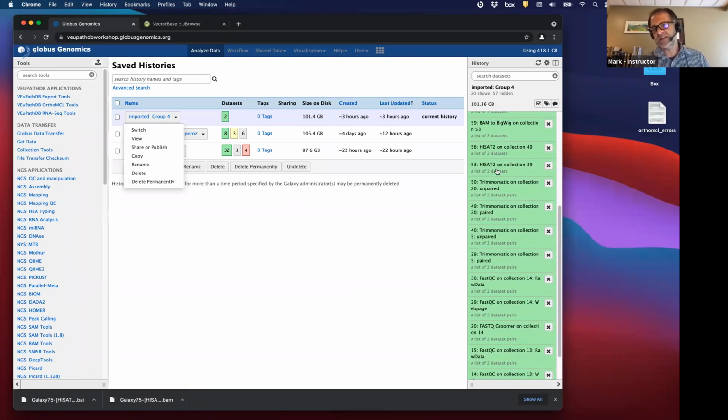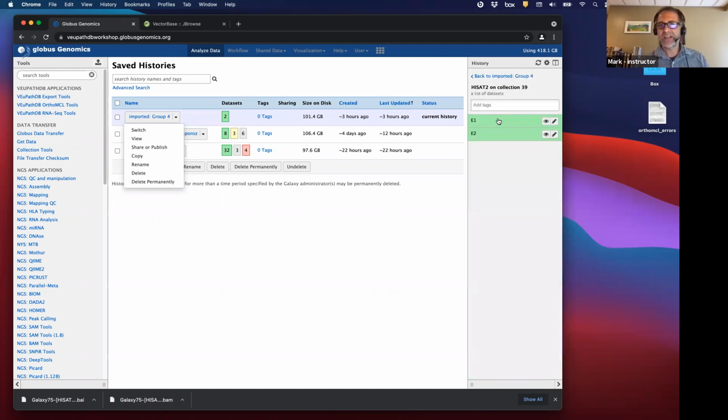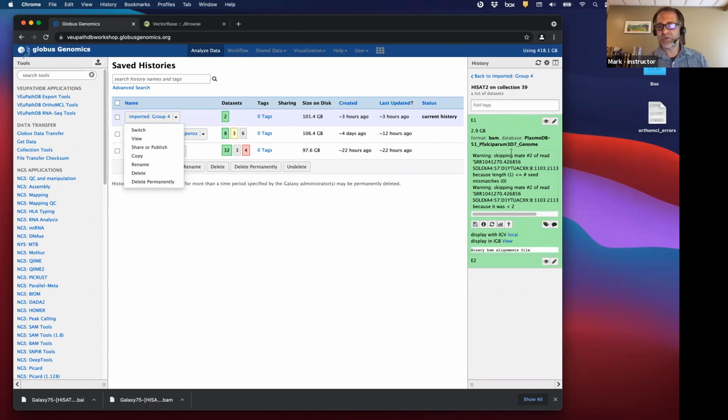And what this does is it's a short read alignment, and Illumina is considered short reads, even though it's 101. It's not like nanopore, which we saw earlier, which is, you know, sometimes 1,000 nucleotides or more. This is considered a short read aligner, and what we get is alignment to a genome, and this is where you have to specify what genome you want to align to. And the result of this alignment is a BAM file. Okay, so that's the next file that we care about, a BAM file.